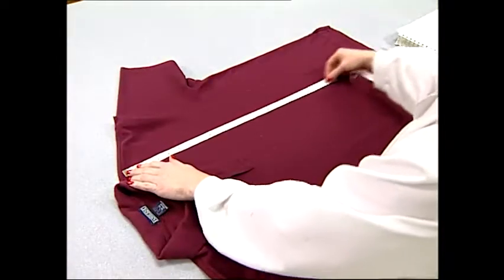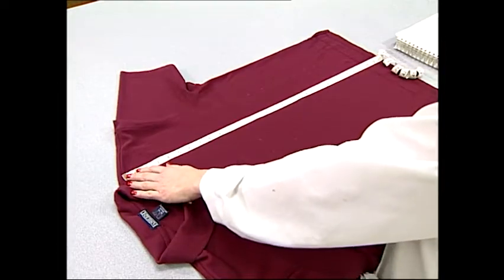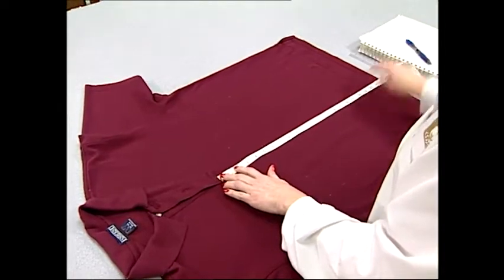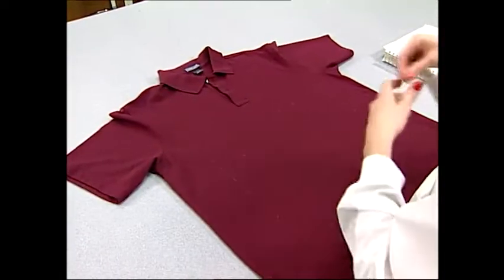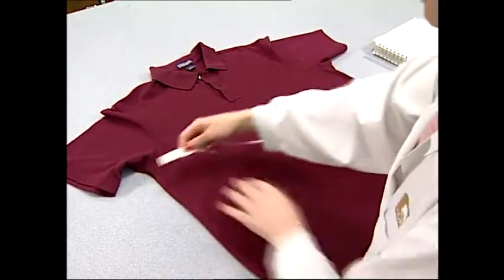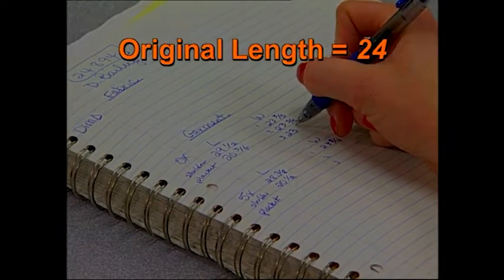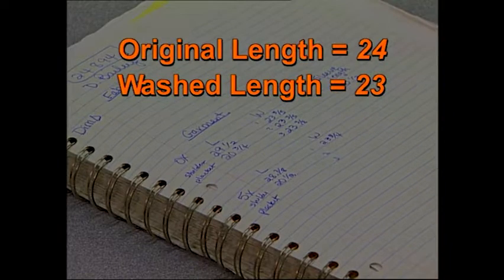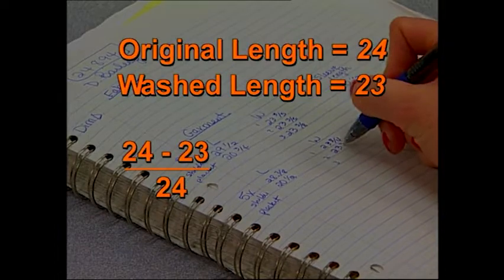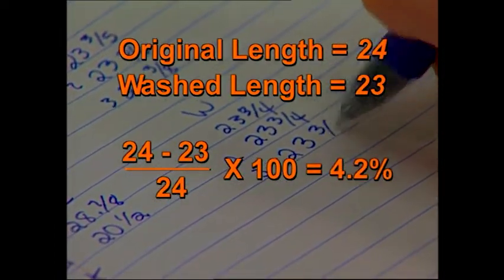After laundering and conditioning, the shirts are again laid on a table and the same benchmarks are measured again. To determine the shrinkage, the length of the washed condition is subtracted from the original length. This difference is divided by the original length and the result is multiplied by 100 to give the percentage. For example, if the original length is 24 inches and the washed length is 23 inches, then the shrinkage would be (24 minus 23) divided by 24, multiplied by 100, giving a value of 4.2% length shrinkage.